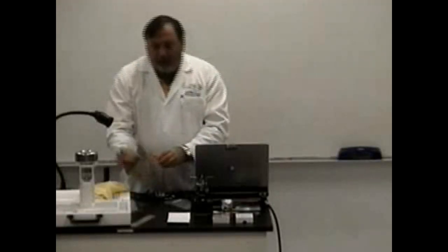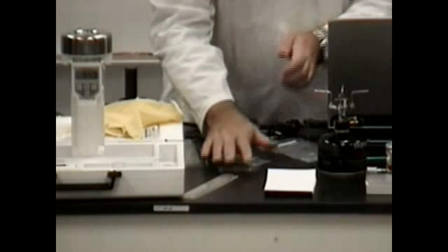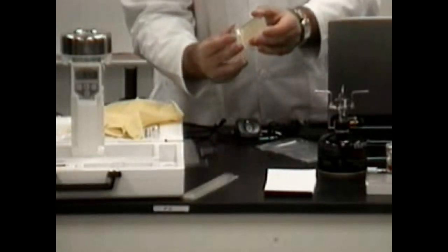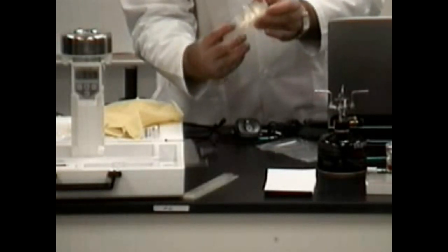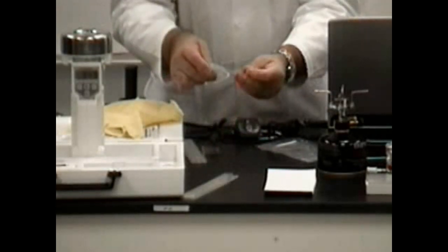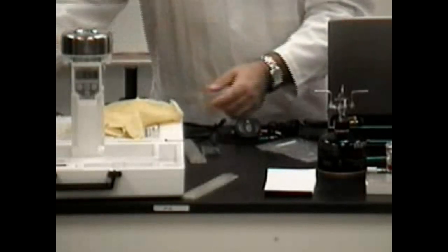Here is a tryptic soy agar sterile contact strip. It opens just like the air strip—we pull it out, careful not to touch the flat agar surface. We simply press it down to ensure full coverage of the 25 square centimeter surface area. Then we place it back into the container flat end up, close it, slide the cover strip back on, and it's ready for incubation just like the air strip.